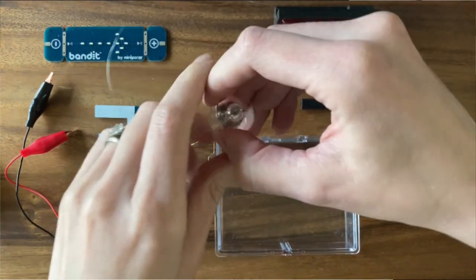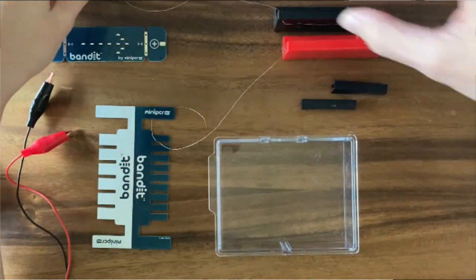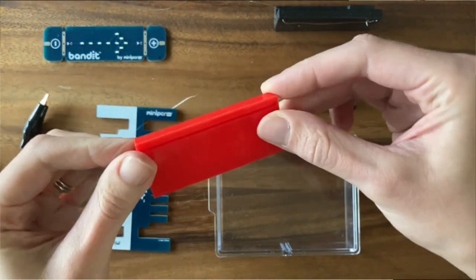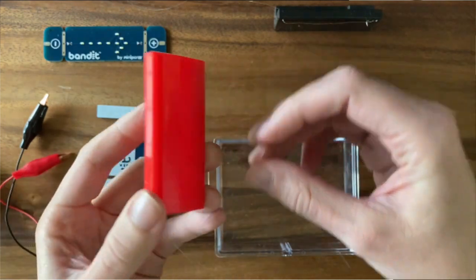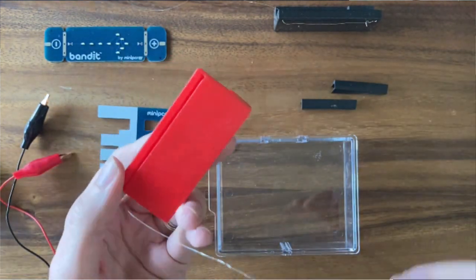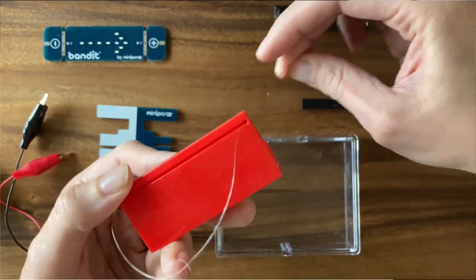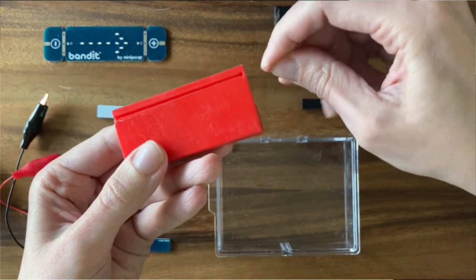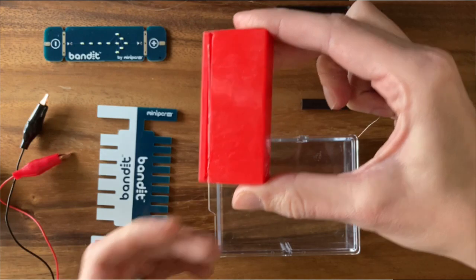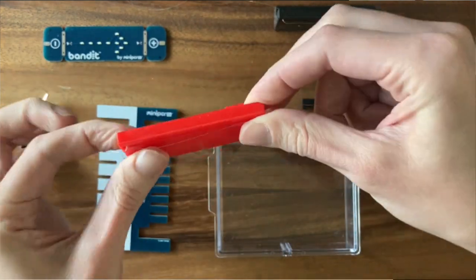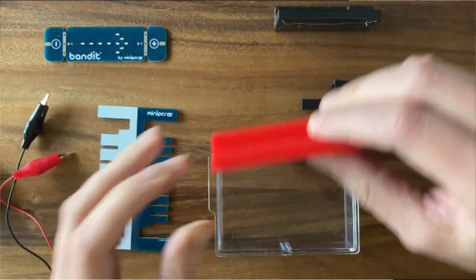Let's take a look at the parts we're going to build our circuit with. This spool of wire is what we're going to make our electrodes out of. We can cut off a length of that electrode, and then we're going to thread them through these silicone bumpers called electrode dams. I can thread this electrode wire through my electrode dam just like this. There's a little channel there that the wire sits in, and that's what's going to support the wire during our run. These electrode dams will pull double duty. Later on, we're going to use them as dams when it's time to cast our gel.